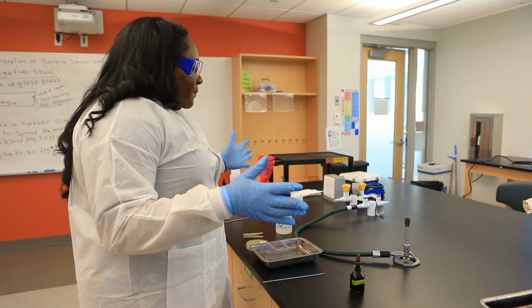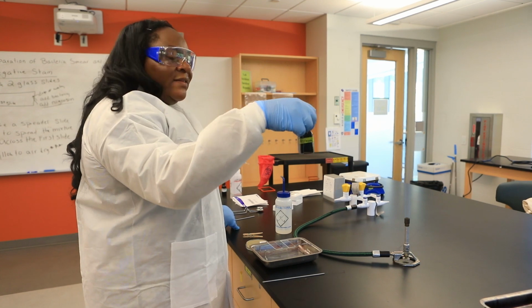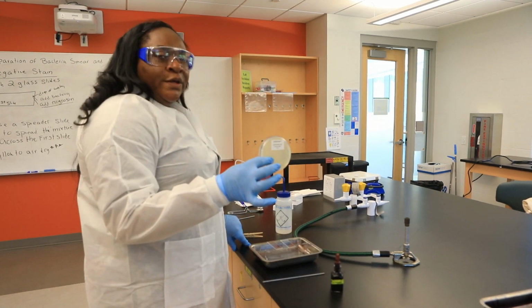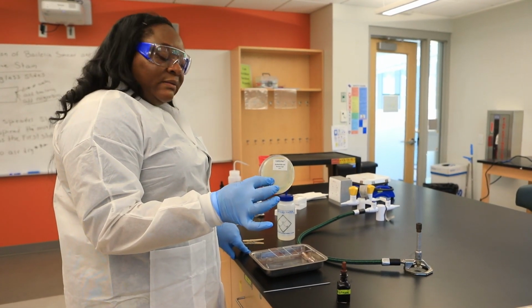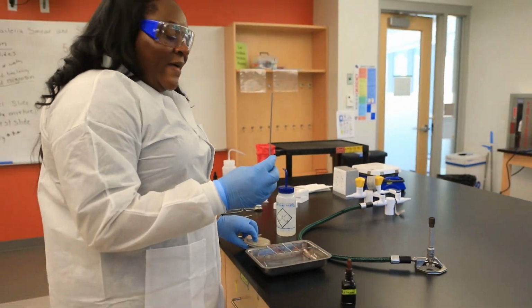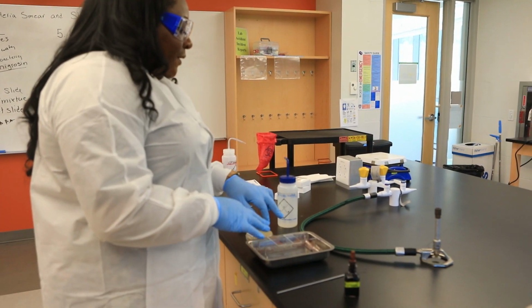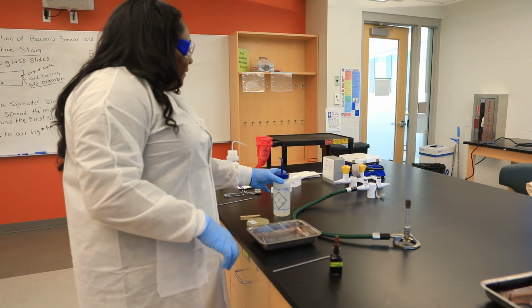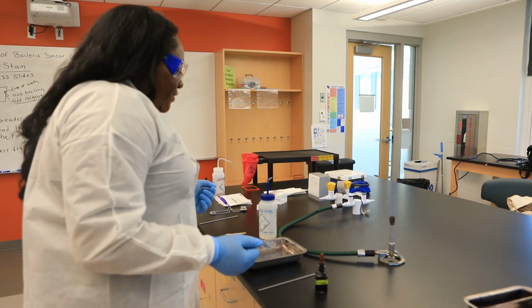So what materials do we need to conduct the negative stain? We need our dye. This is our nigrosin. And I'm going to switch up the bacteria this time. We're going to use our good old Escherichia coli, known as E. coli. Okay. Also, an inoculation loop. We need that to transfer the bacteria aseptically. I have the staining tray. We have our two glass slides that are on the platform. All right. And I also have the distilled water. Okay. So let's get started.